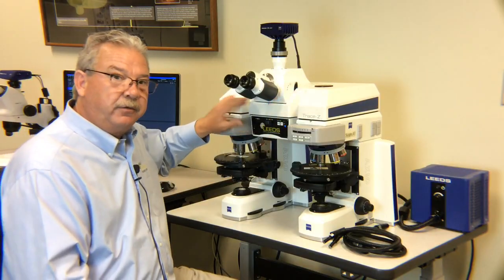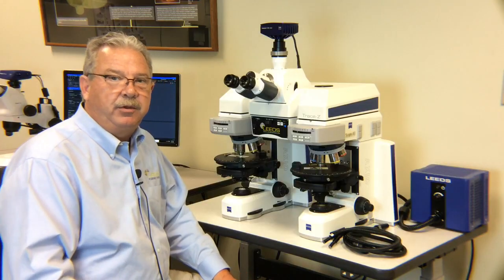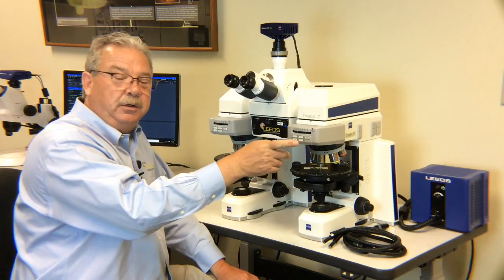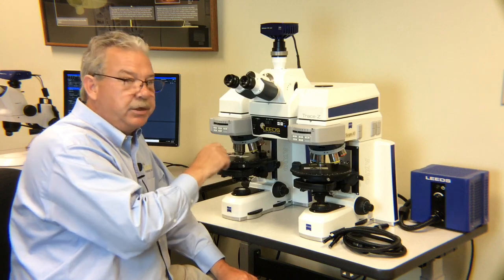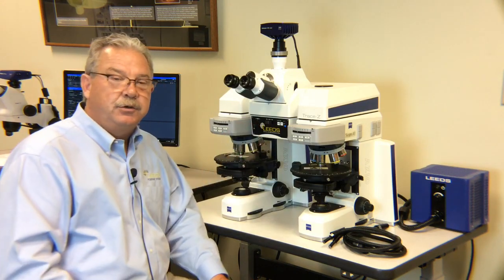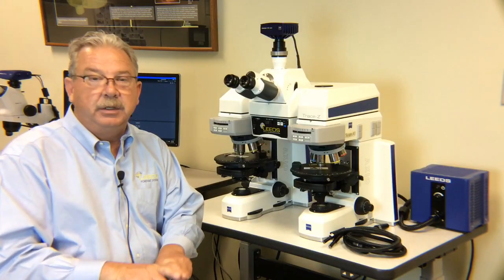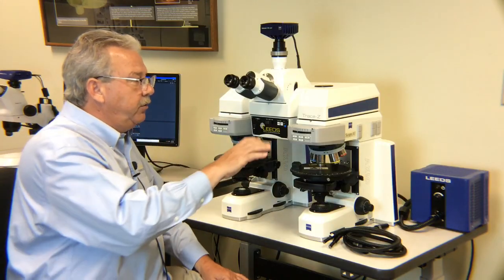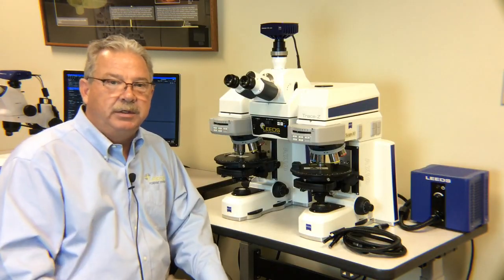Quickly, I'm going to take a look at the front control panel here. Know that this is going to be covered much more in depth in our discovery video, but I've got a slider here that allows me to look at all of the right microscope image, all of the left microscope, and any sliding percentage in between. I have the ability to control the separation between the two images. Typically there's a little black knife edge that you will see that's defining for you that there are two separate microscope images and not one continuous.